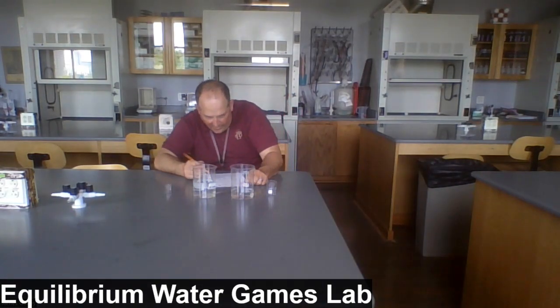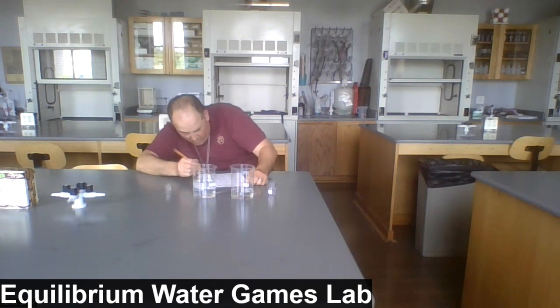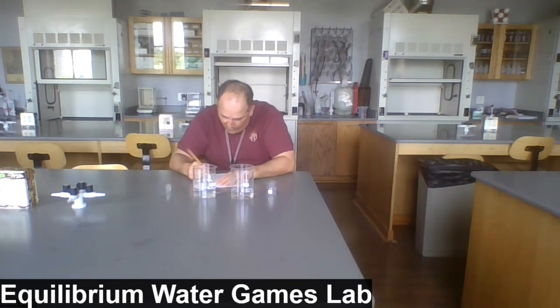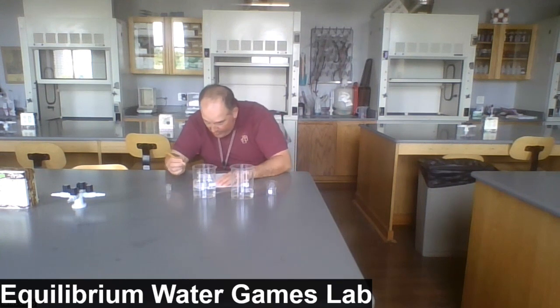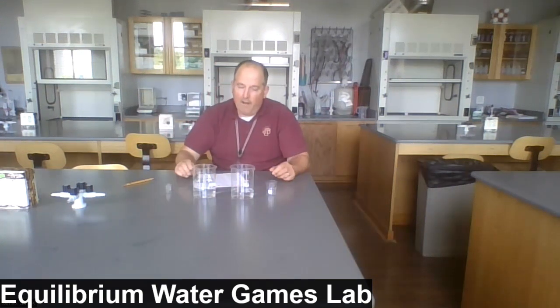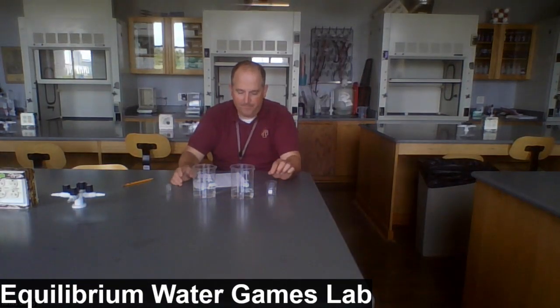And after transfer cycle 3, we're down to 140. Let's call it 145. 145 in beaker A, and 365 in beaker B. I'll have all these numbers on the board for you to look at shortly.